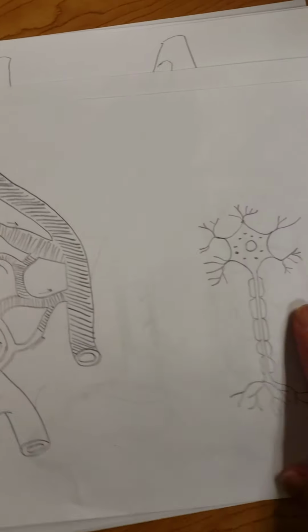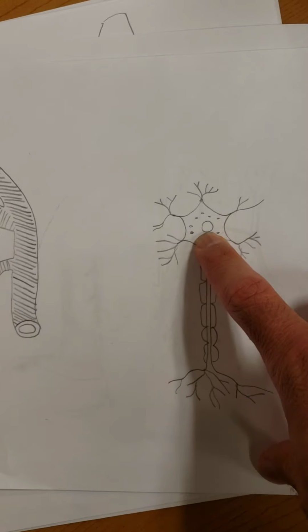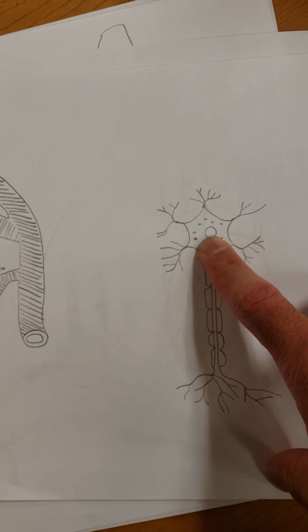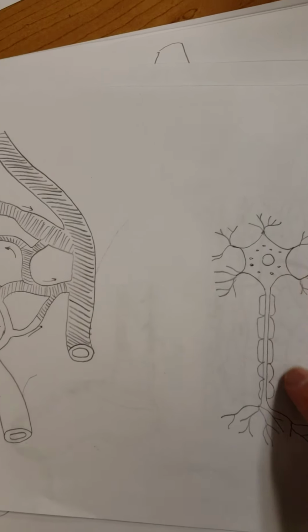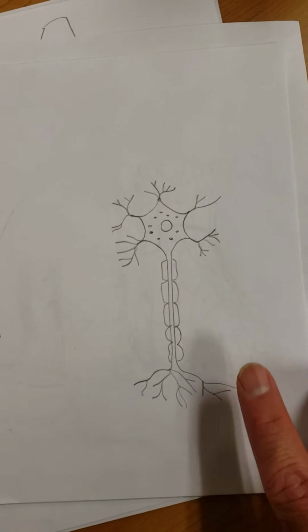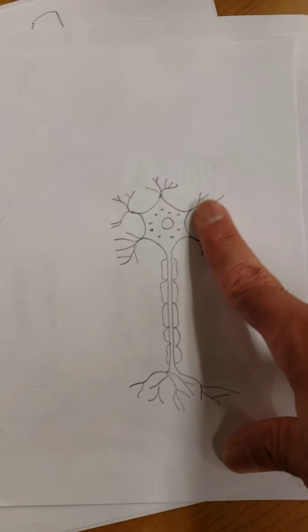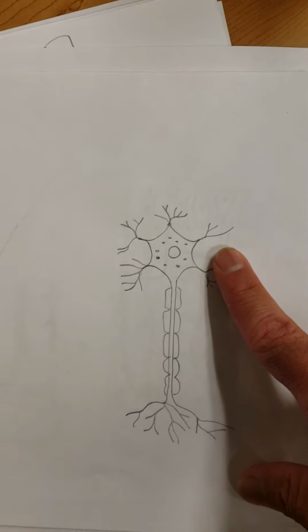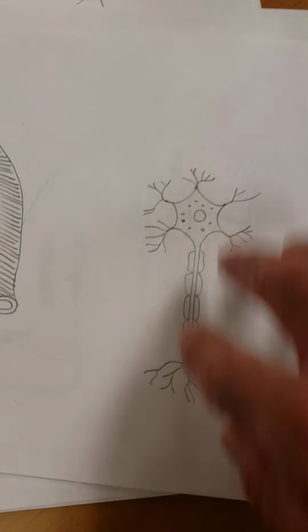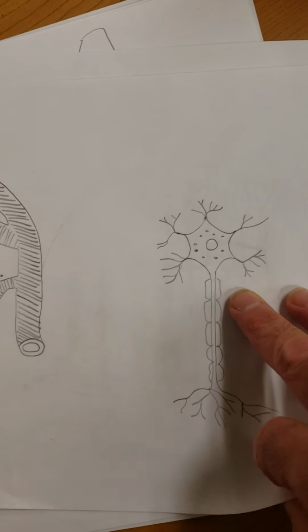Over here in the nerve, you have the nucleus, which is the main portion of the cell body. This area right here and this area right here, the little lightning strikes, this one's the axon, and this one is the dendrites. They pretty much give little signals to each other. They're like nerve endings of the nerve. Next picture on here is part of the compact bone.